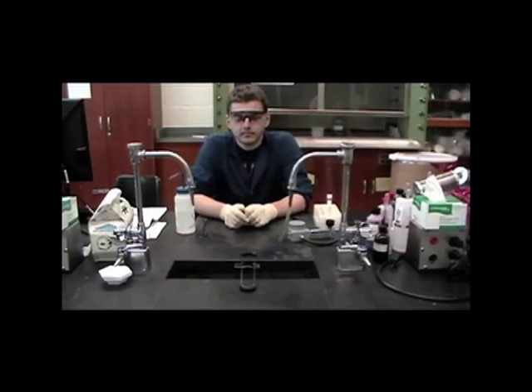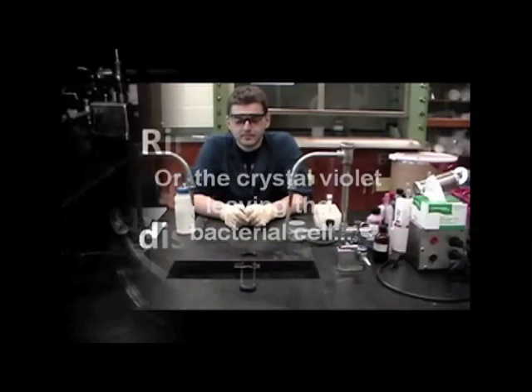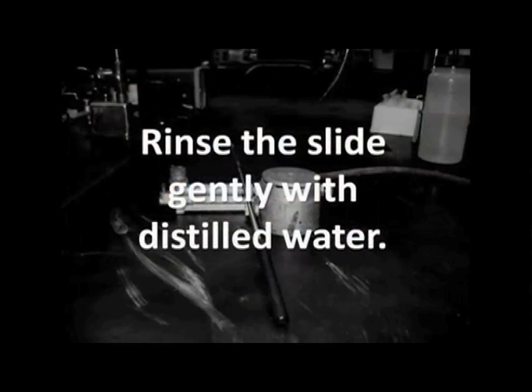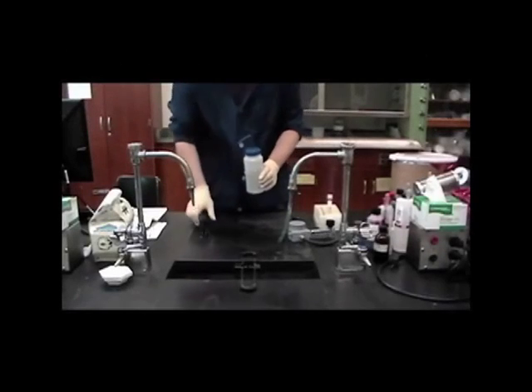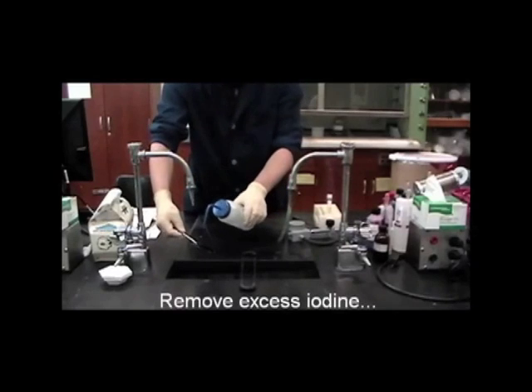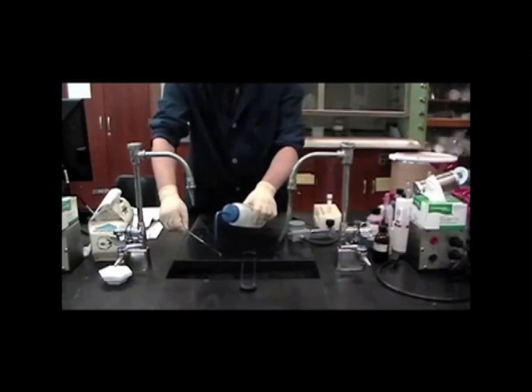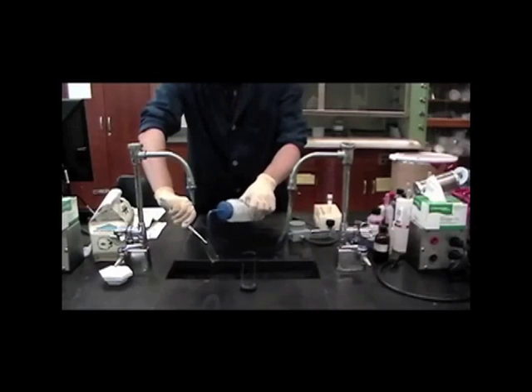This reaction will lead to either the crystal violet staying within the bacterial cell or the crystal violet leaving the bacterial cell. The slide is rinsed to remove excess iodine, and an iodine crystal violet preparation is now on the slide.